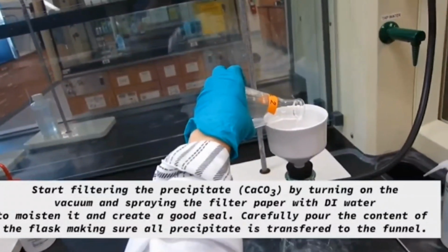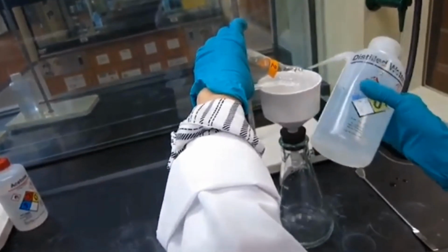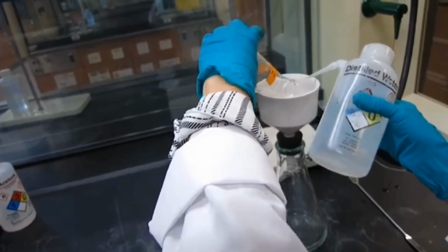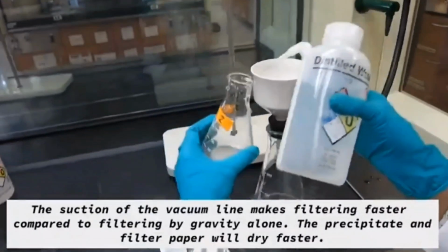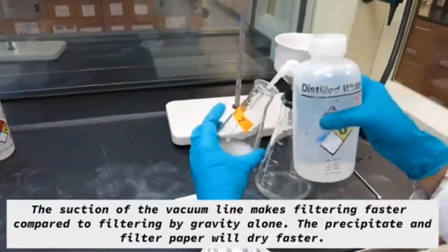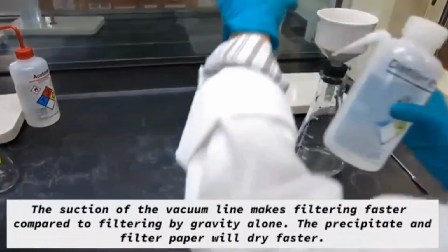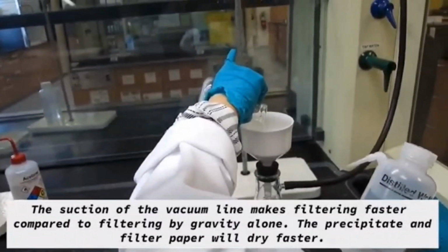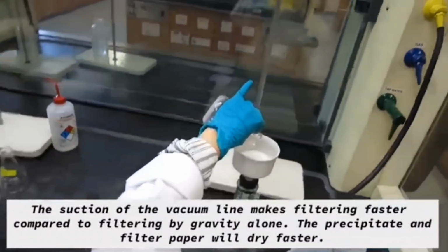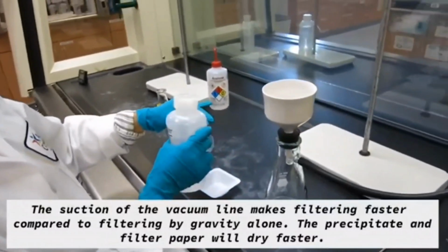So after you turn on the vacuum, before you pour your calcium carbonate sodium chloride solution, you have to put a little bit of deionized water onto the filter paper to have good adhesion and suction. And then you're going to pour your calcium carbonate solution over the vacuum Buchner funnel.